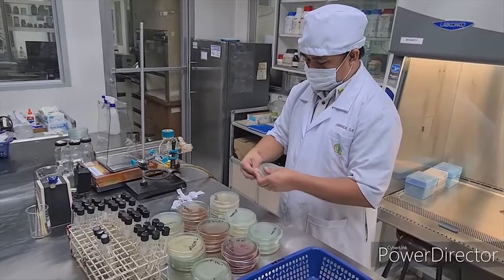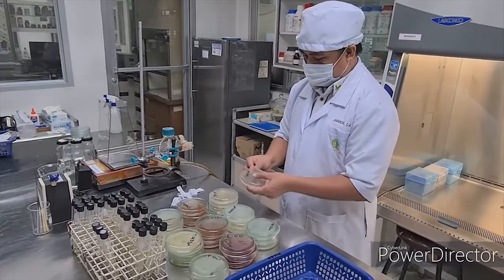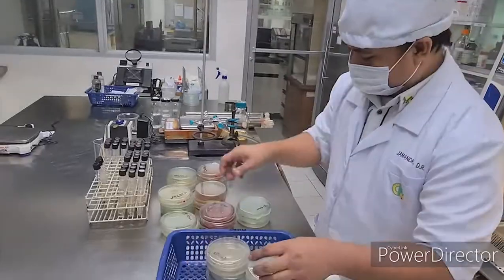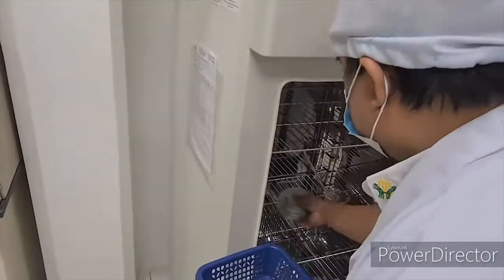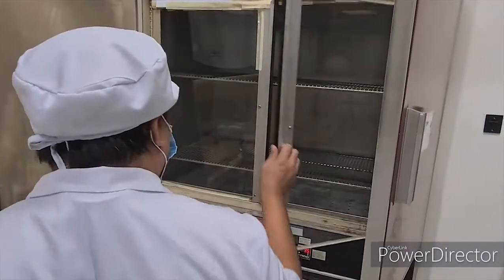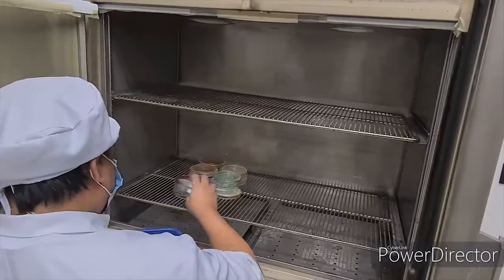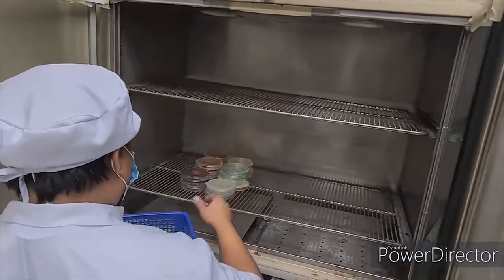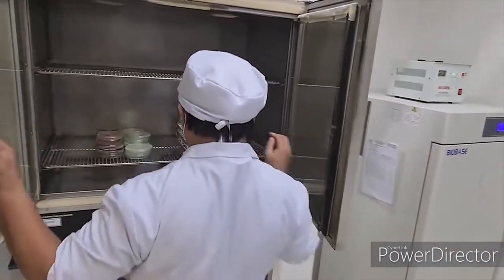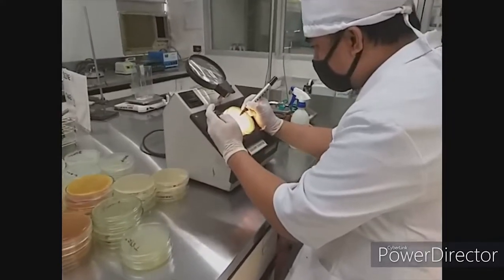Once the agar has set, the plates are put inside the incubator to optimize the growth of the microorganisms. Incubation time depends on the parameter. For aerobic plate count and coliform count, 48 hours. For yeast and molds count, 5 to 7 days.